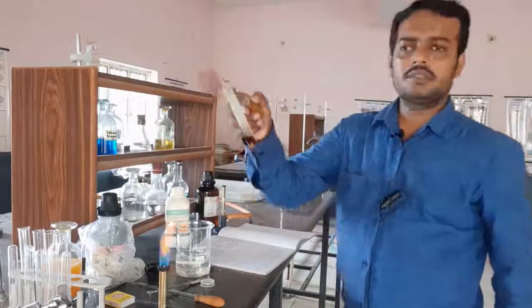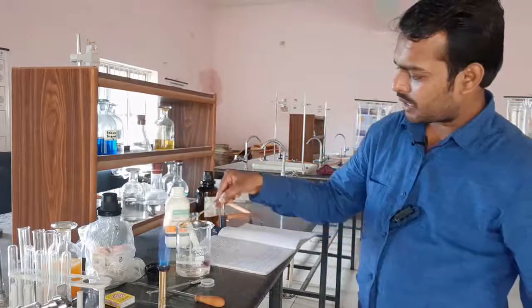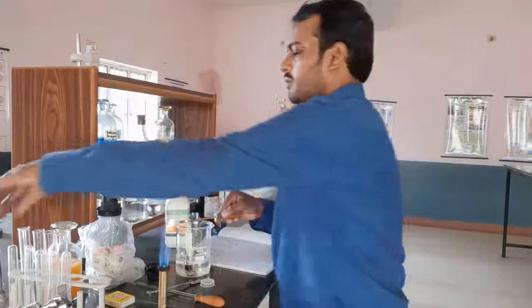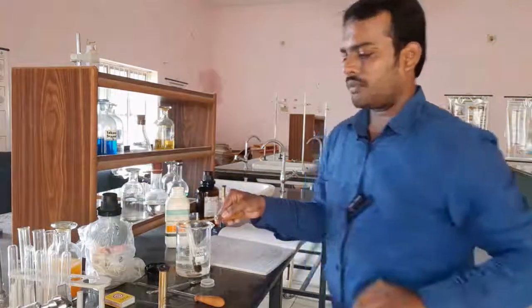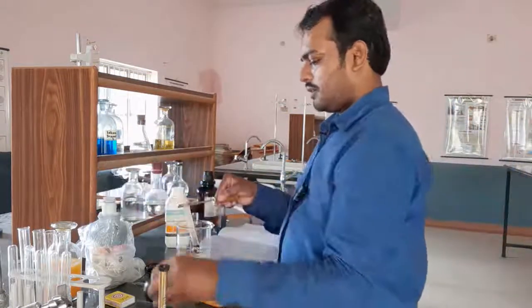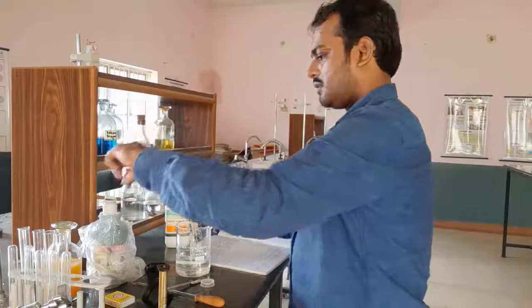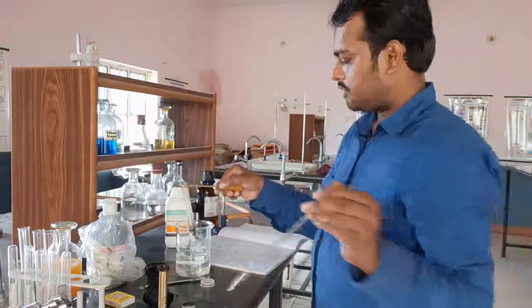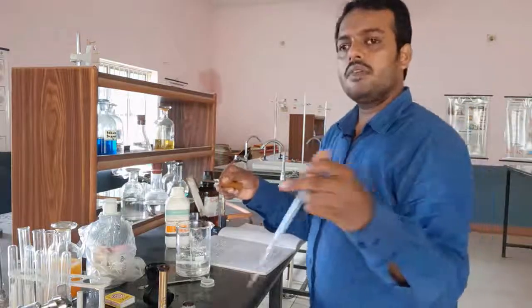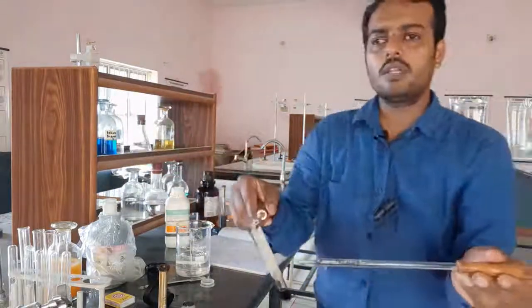The content will be cooled for some time. We have taken a small quantity of water so that the content can cool and the burner is switched off. To this we will add around 1 ml of concentrated H₂SO₄, which is very dangerous — we have to be very, very careful when adding the concentrated H₂SO₄.